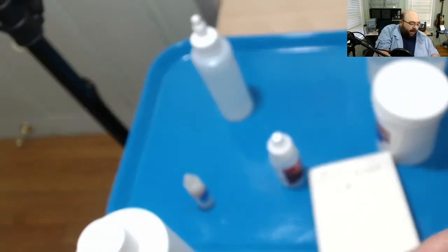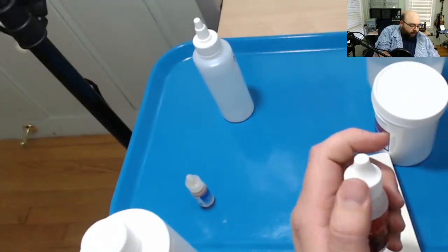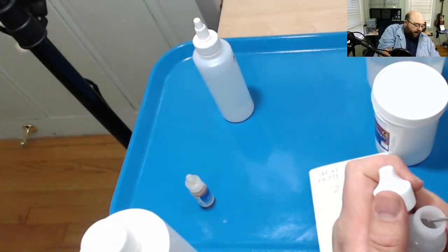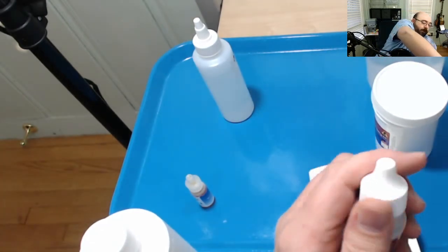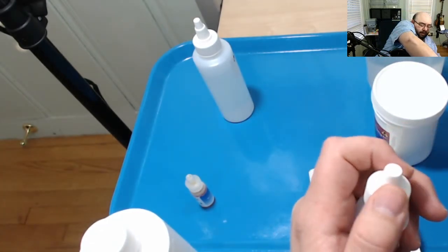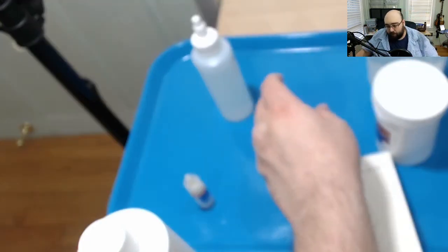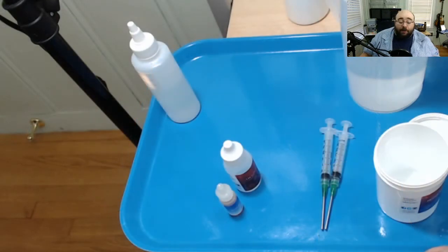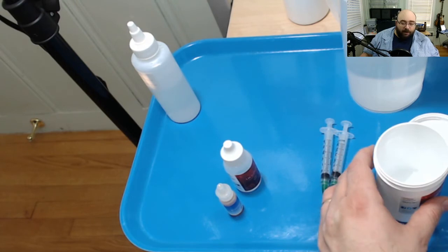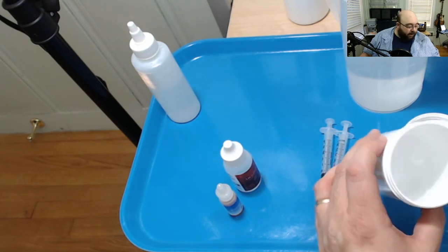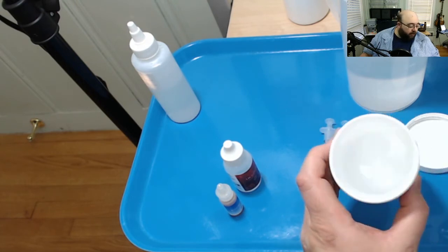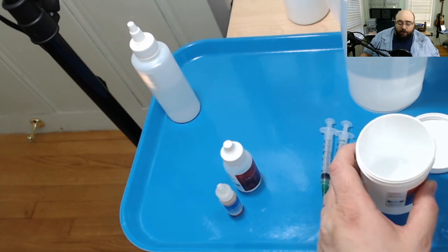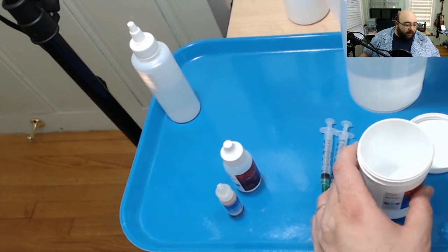Now I've got the remaining acid. So it's safe to put the acid back in. We're going to rinse it out right away. And we're done. OK. I went and I immediately cleaned everything up. Just because again, everything here is technically toxic. And I wanted to make sure we controlled any spills or eliminated any risks. So that's taken care of.